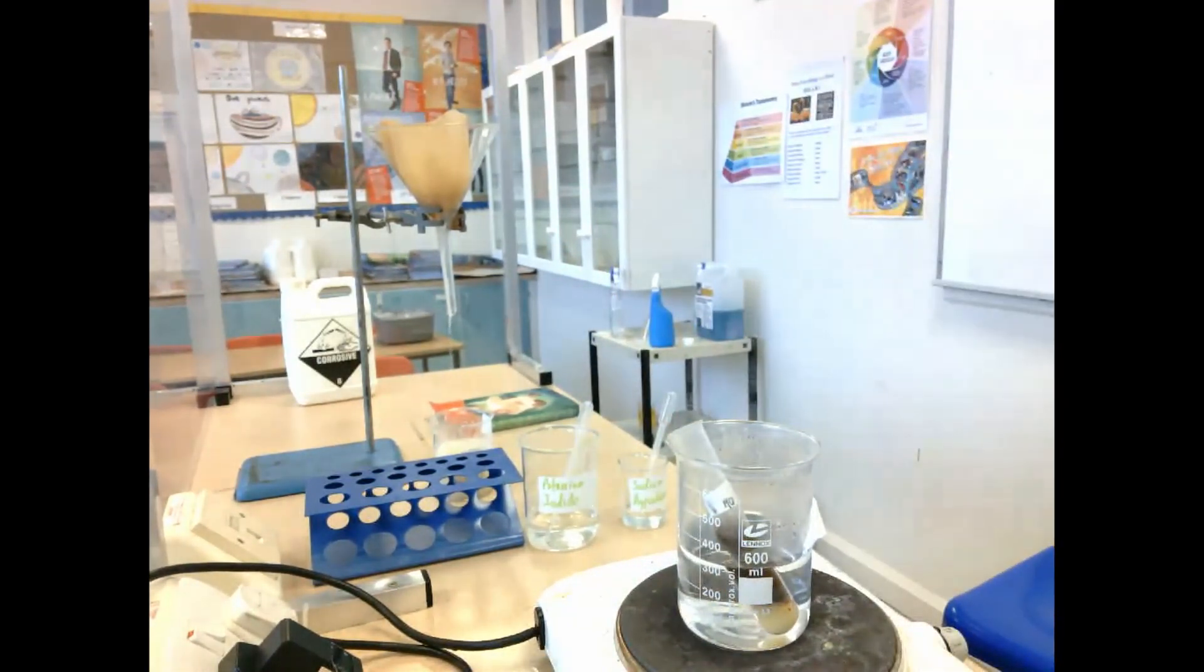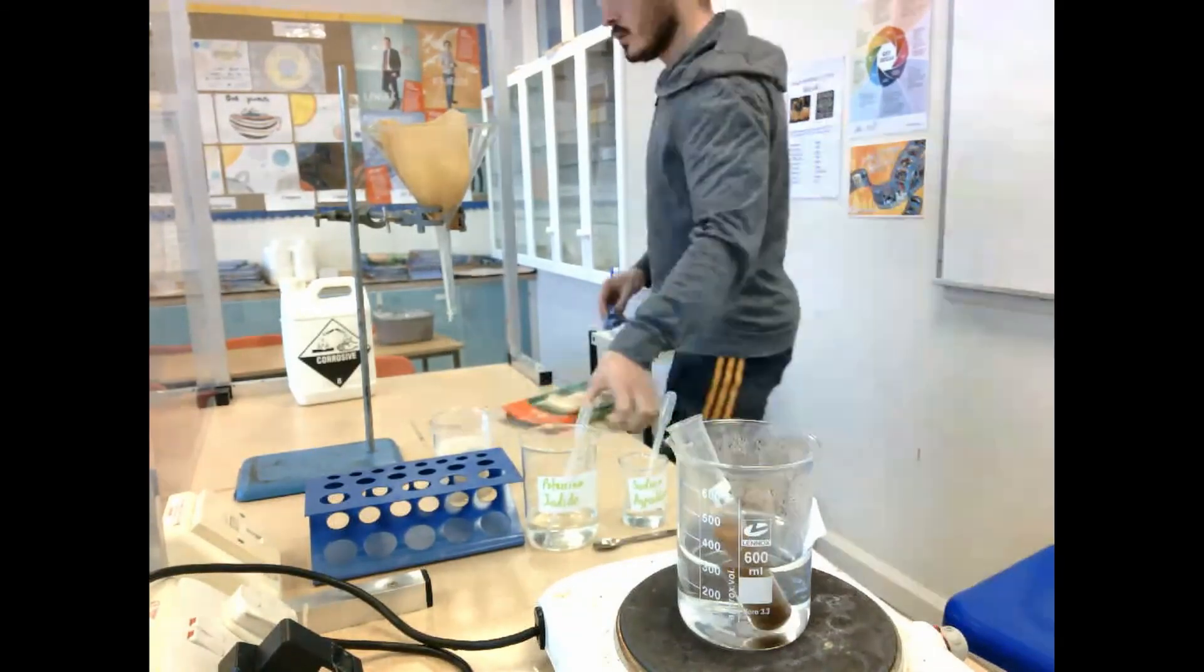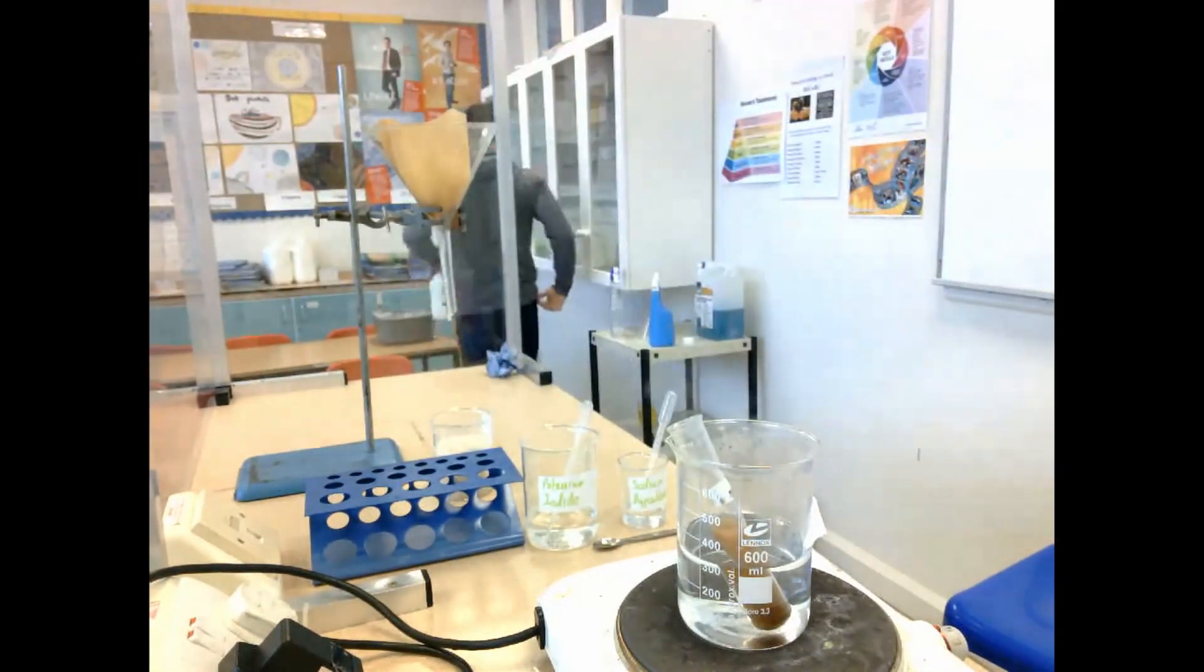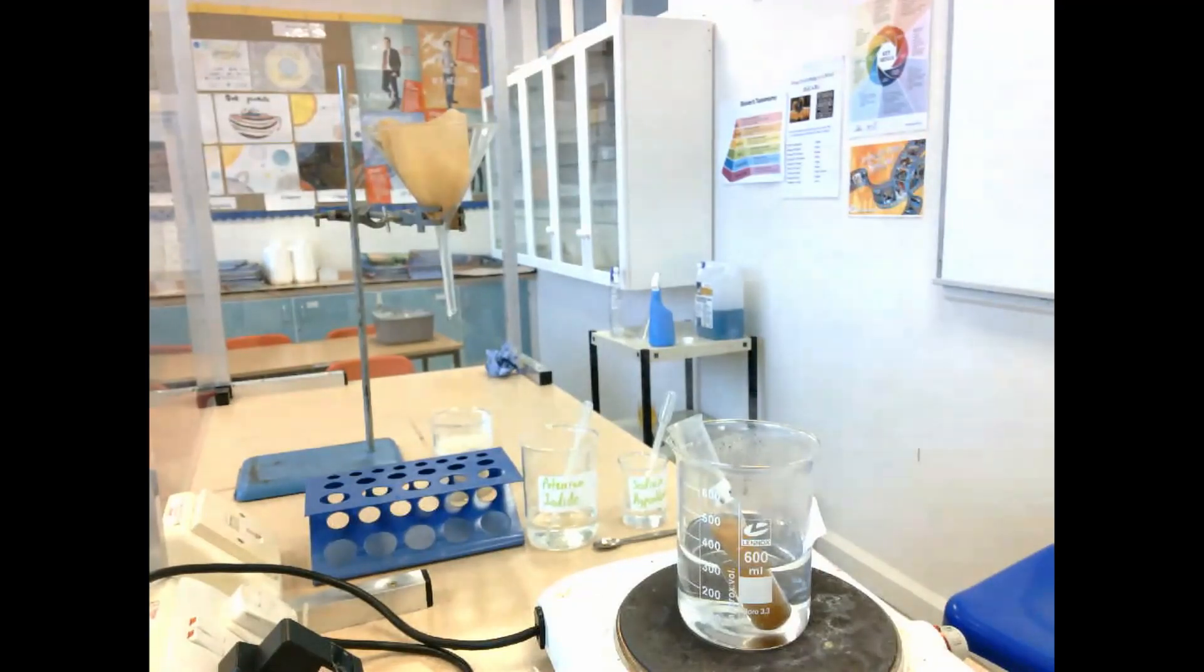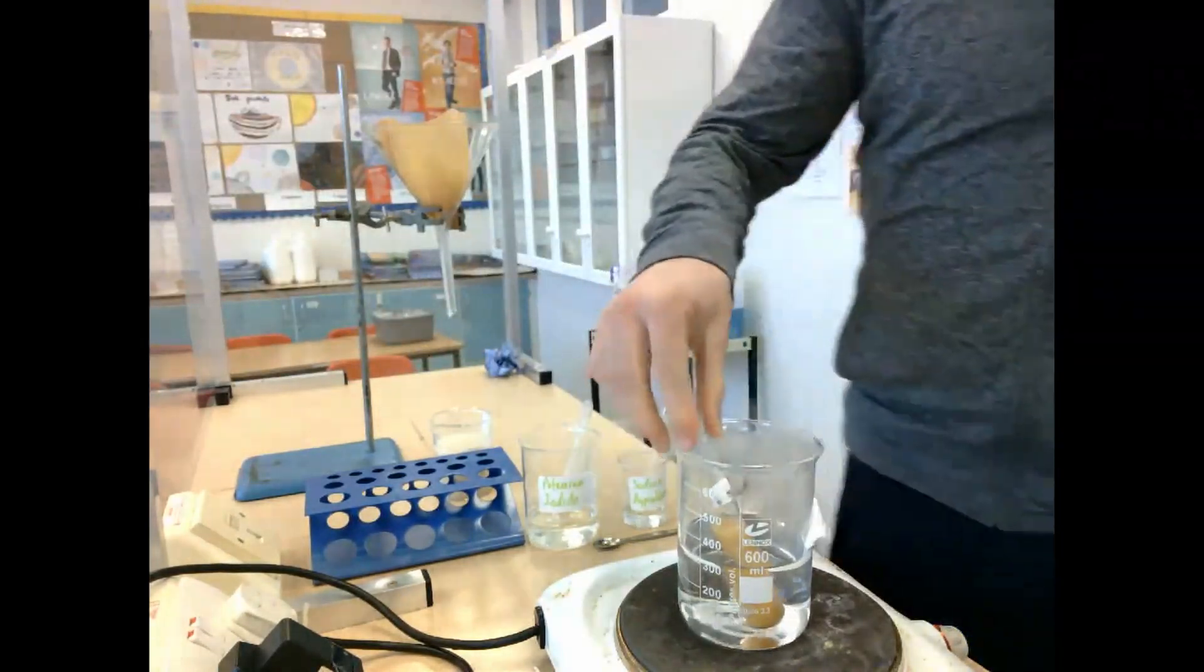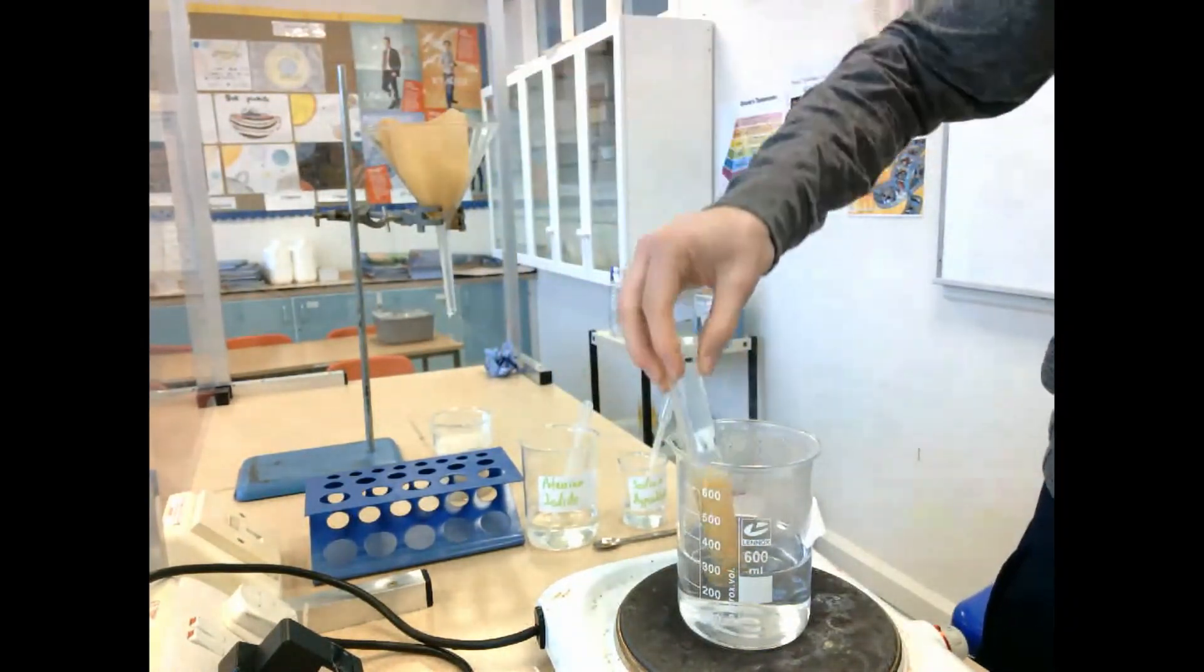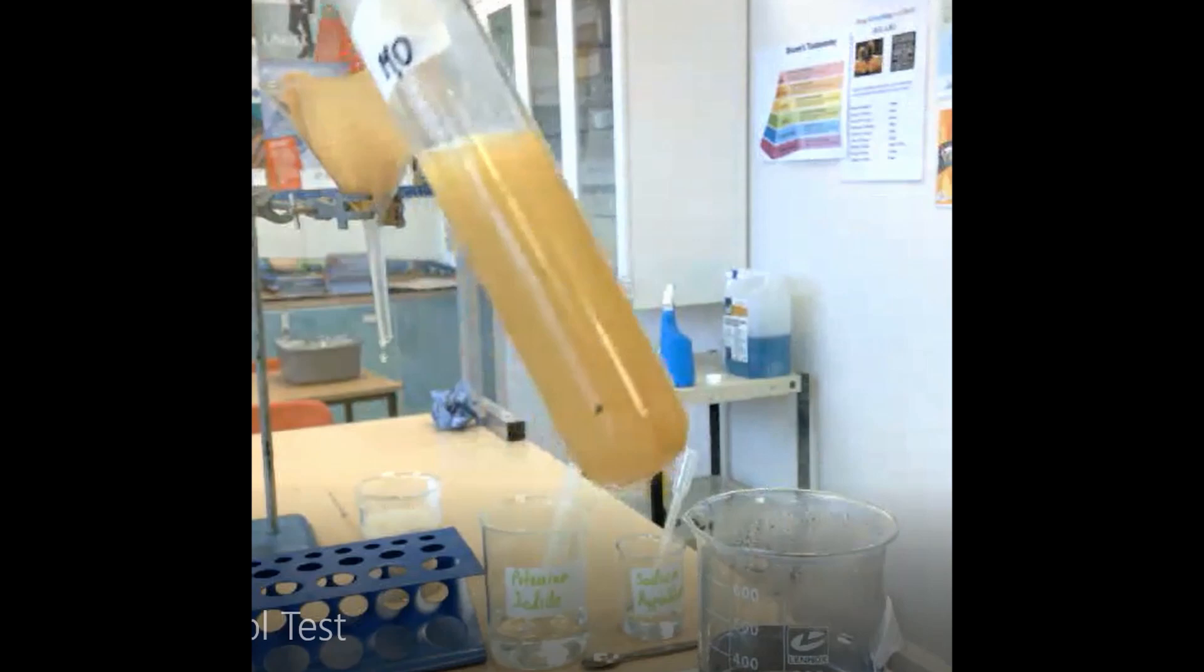I left this reaction running for a few minutes and as you can see the color starts to alter slightly and become slightly more yellow, until eventually after about five minutes the yellow color was really, really distinct. And voila, we have alcohol!